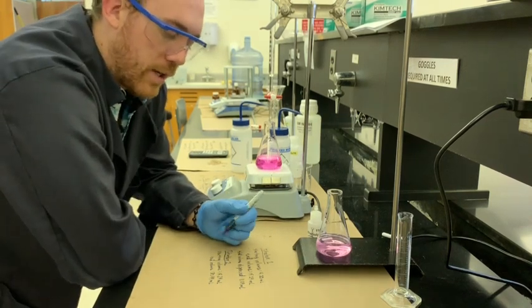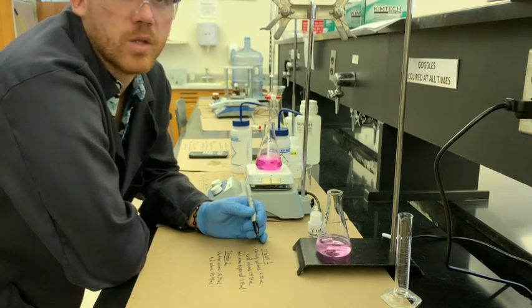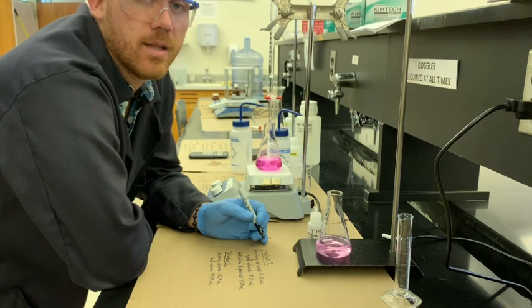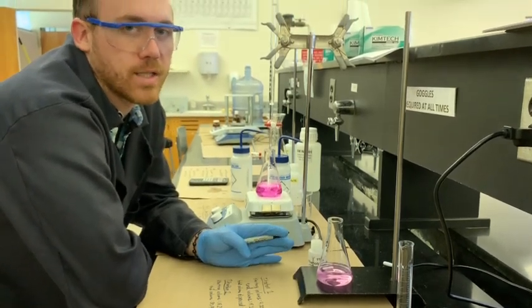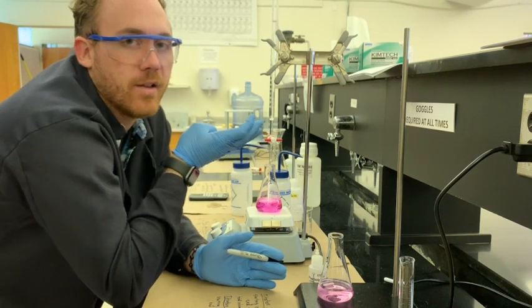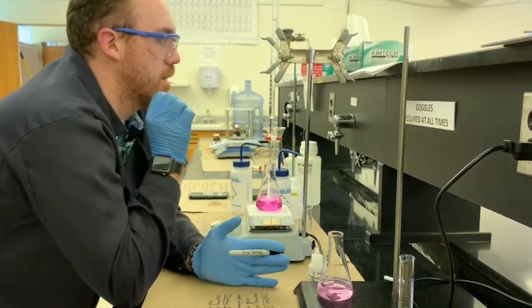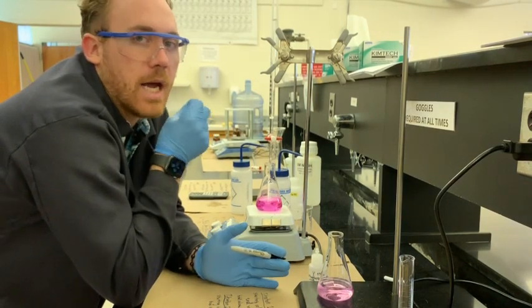So if you look at the difference between those two, it's going to be somewhat proportional to the actual mass of KHP that was added to the flask in the beginning. And the math, as I mentioned before, will work itself out. If you have a little bit more KHP in this sample, it's going to take a little bit more NaOH. If you have less, likewise. It's going to work itself out in the math. The important thing is that you take as many of the significant figures as you can and record everything.